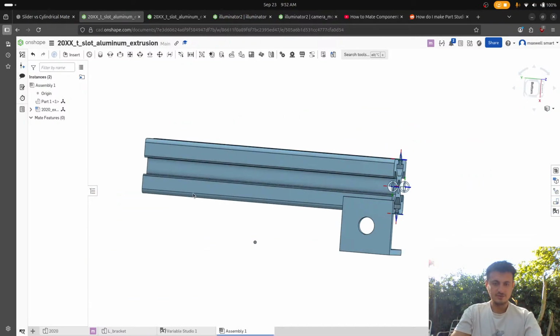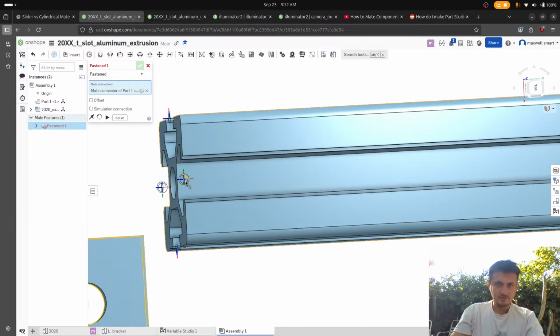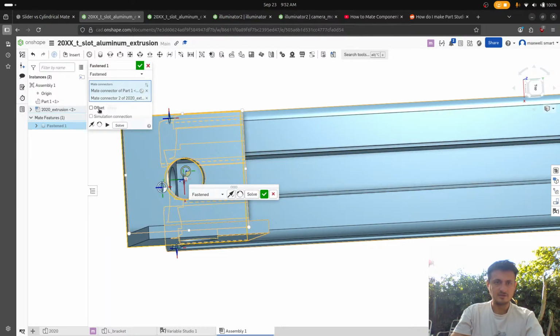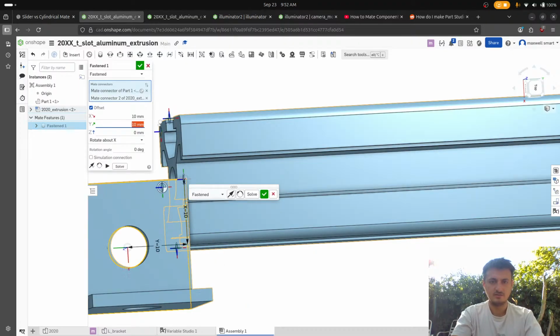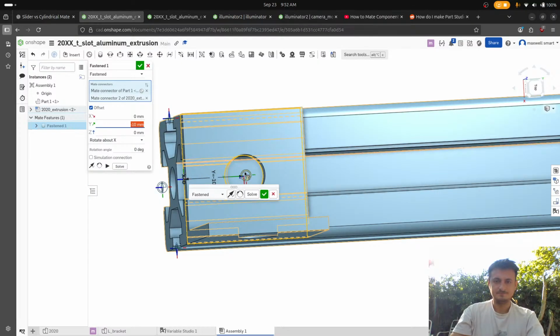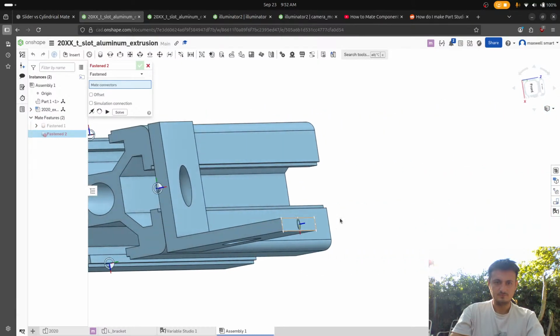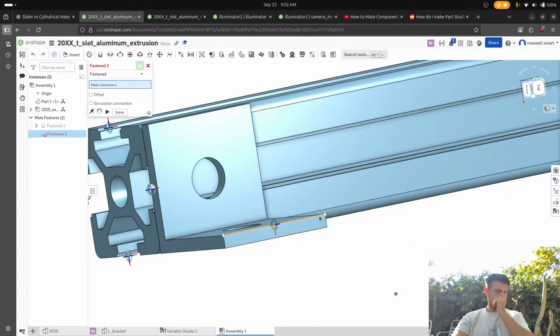So now what we can do is we can just go like this. And then get that. And then just offset the X by 10. Oh, I guess I messed that up. By 10. Oh, this is supposed to be 0. This is supposed to be minus 10. And then you just put a T-nut in there.